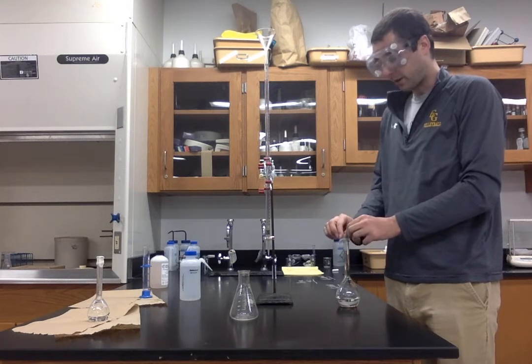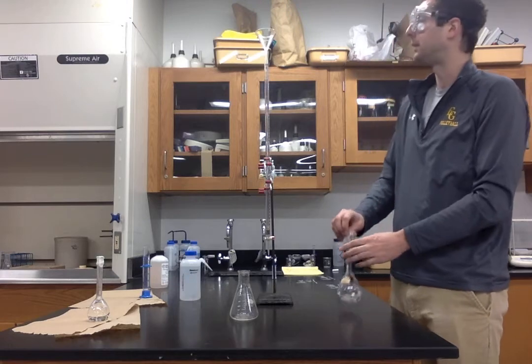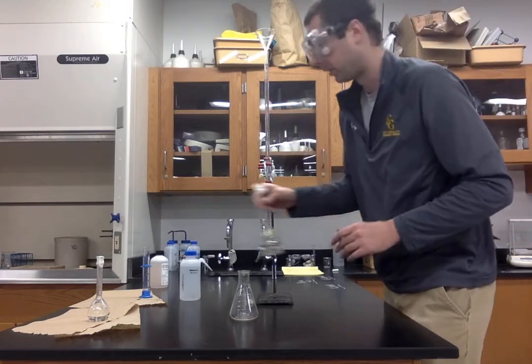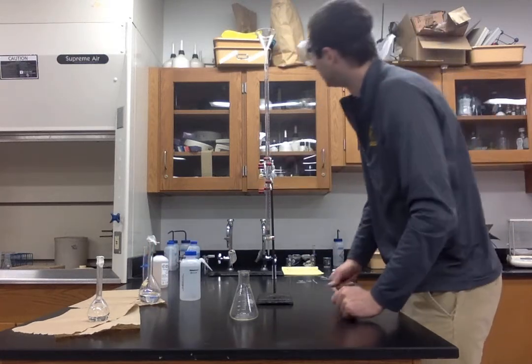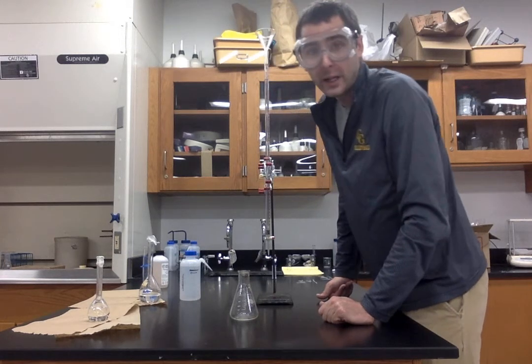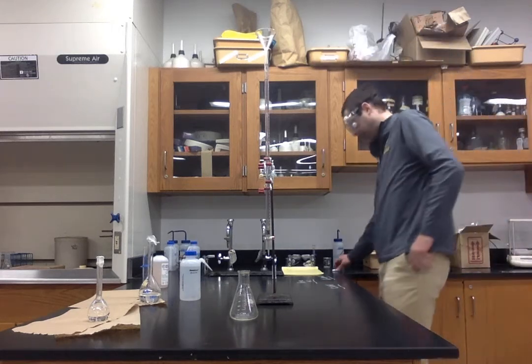So what we're going to be able to do, ladies and gentlemen, is have a specific amount of sodium hydroxide used. So it's important to jot down the initial volume of sodium hydroxide. Let's go ahead and do that now. So taking a look here, I'm seeing this right at about 0.90 milliliters to start. So let's jot down that value.